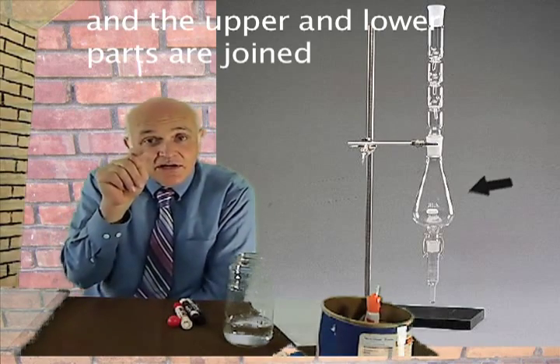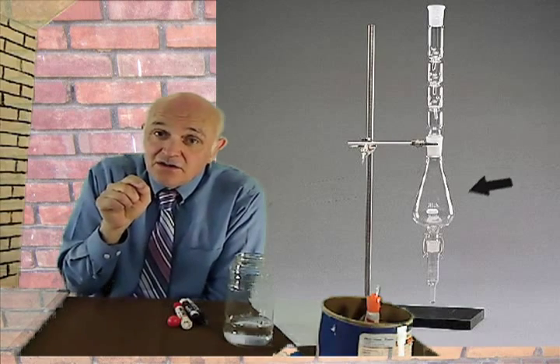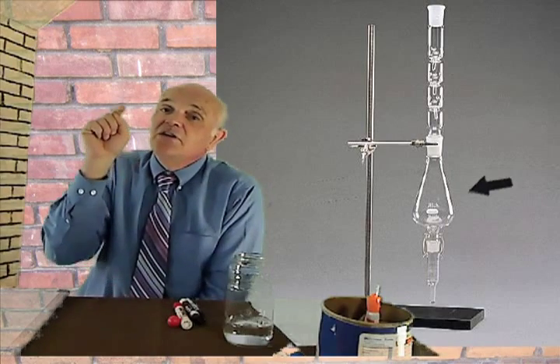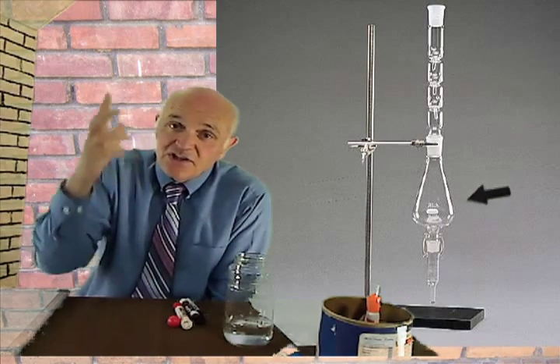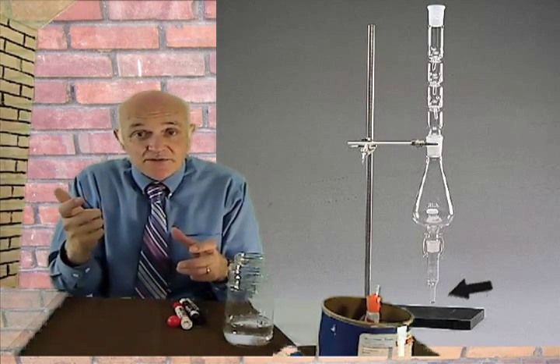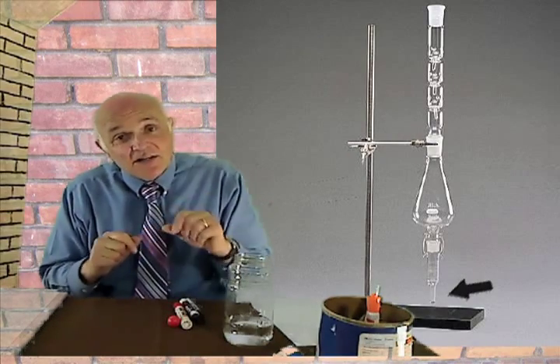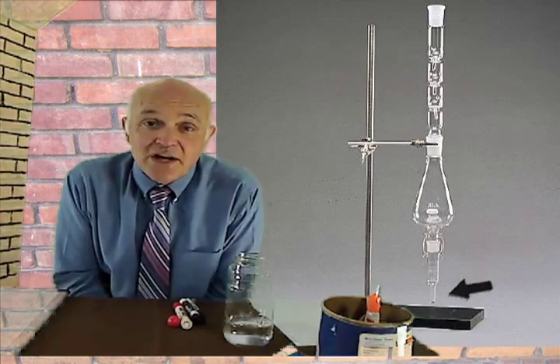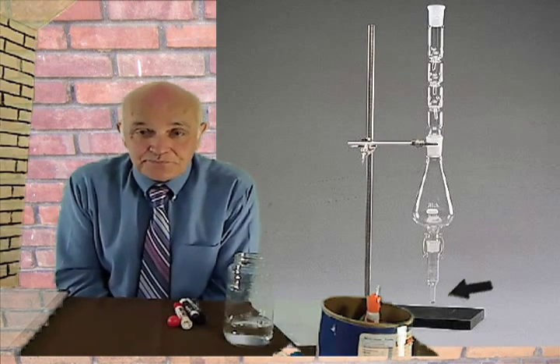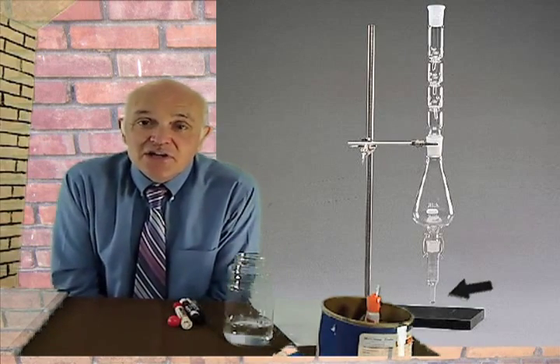And as soon as the liquid gets down to exactly 1 milliliter, there's a mark on the graduated cylinder. As soon as it gets down to 1 milliliter, the operator, the technician, takes a Pasteur pipette, disposable pipette, draws it off, puts it in a labeled autosampler vial, one of these little tiny vials. Those vials hold about 1.5 milliliters or something like that, so it pretty well fills it. And then crimp seals it, and that's it, and he's done. And then it goes to the operator.